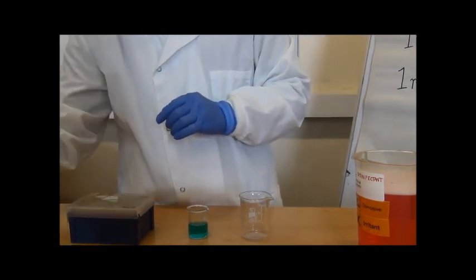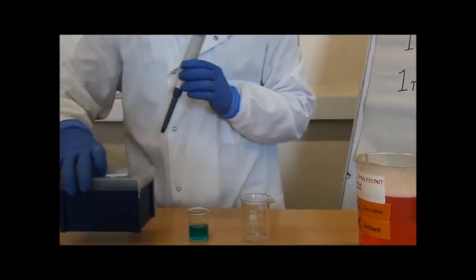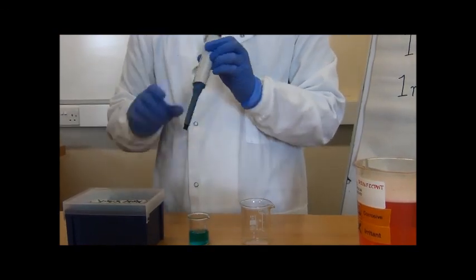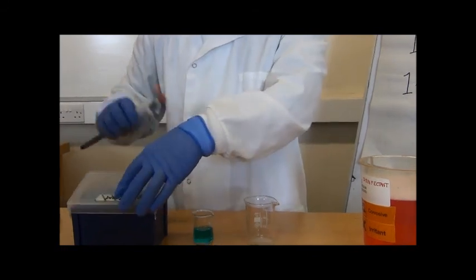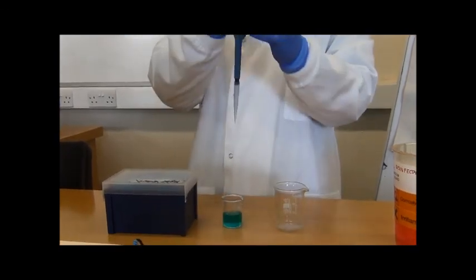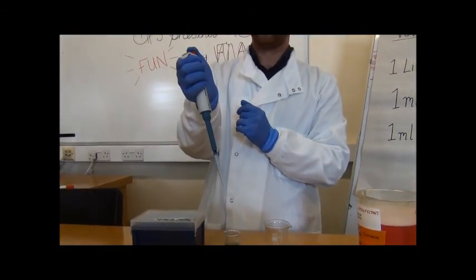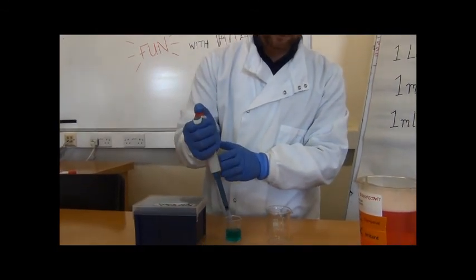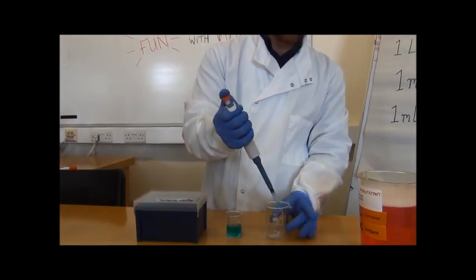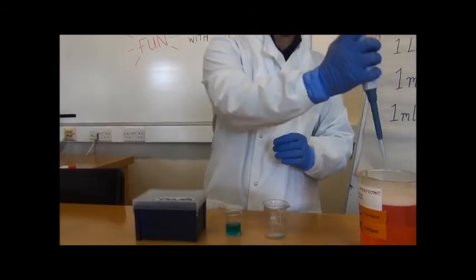The next example, we're going to use a slightly larger volume, and this time it's 500 microlitres. It's a different pipette this time and different tips. It's blue tips this time. So we open the box long enough to select the pipette tip and close it again. 2 stopping points as before, down to the first one. Slowly bring the solution up. Transfer, release slowly all the way down, second stopping point, discard the tip.